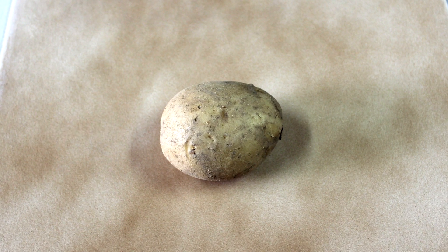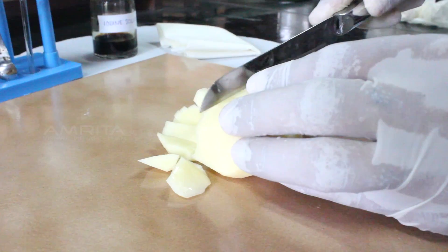Procedure: Place a potato on a tile. Chop the potato into small pieces using a knife.